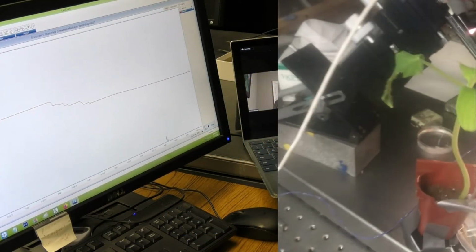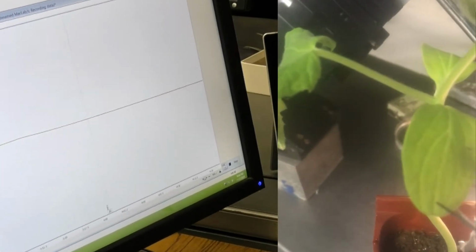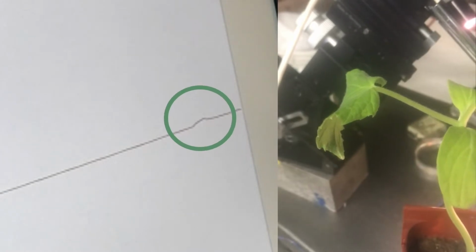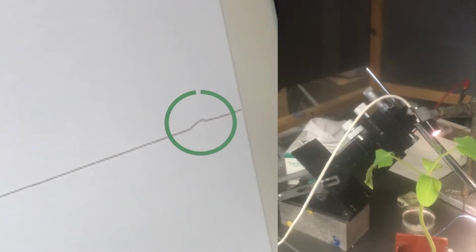Okay, so now we're going to cut a leaf, right? Yep. On the opposite plant that we're recording from. Ready? And I will cut a nice snip off right off this thing. Ready, get set, go. Oh, a little artifact. But I wonder if that's movement. Let me cut again. I'll cut up higher this time on that thing. Yep. A bigger change. But I wonder about movement.